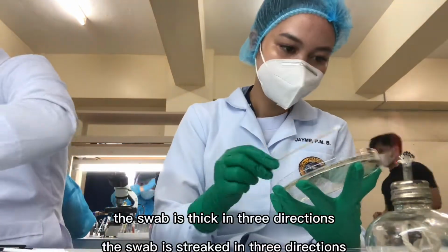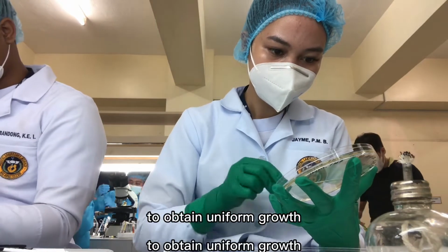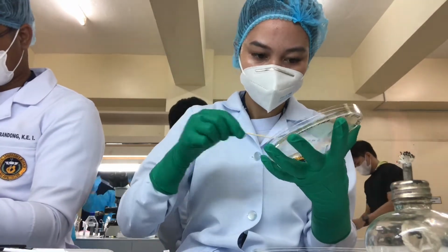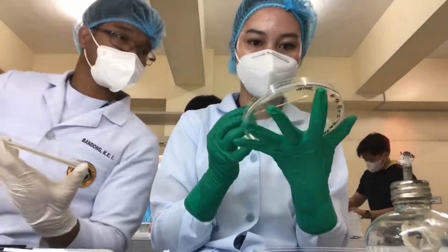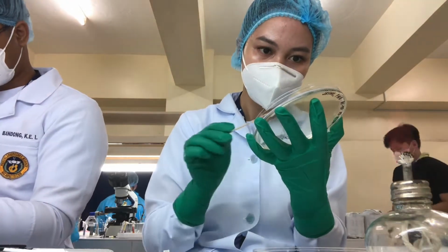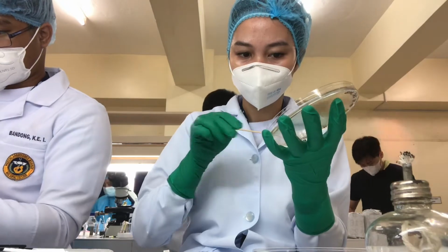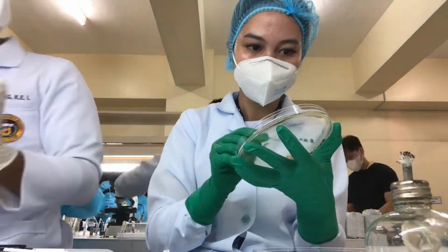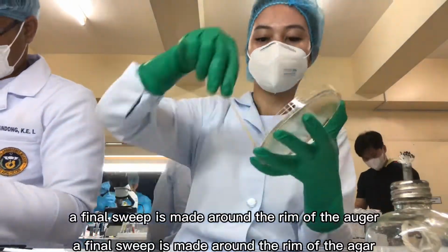The swab is streaked in 3 directions over the surface of the Mueller-Hinton agar to obtain uniform growth. A final sweep is made around the rim of the agar.